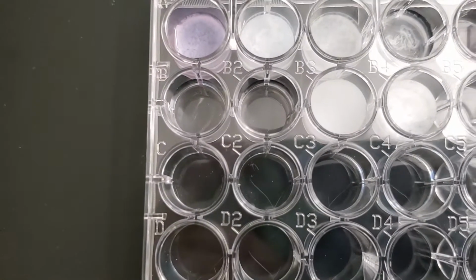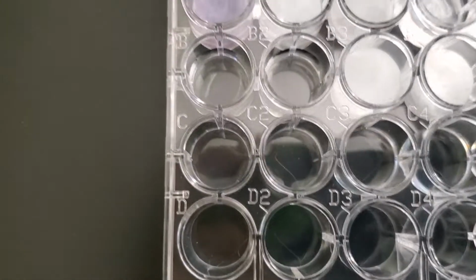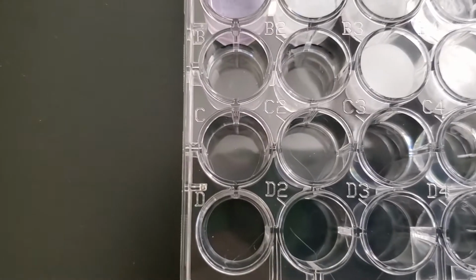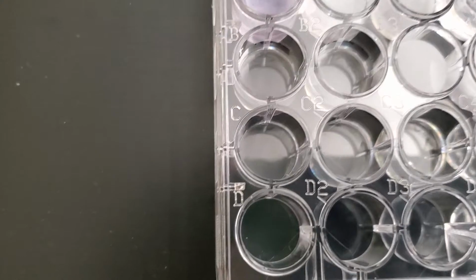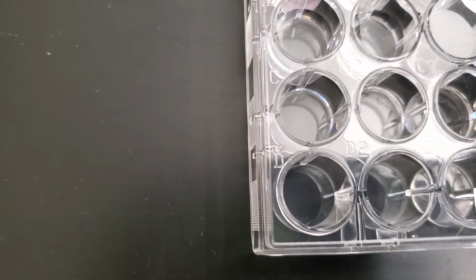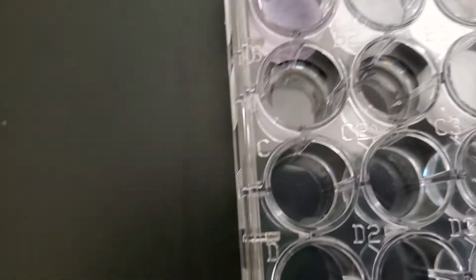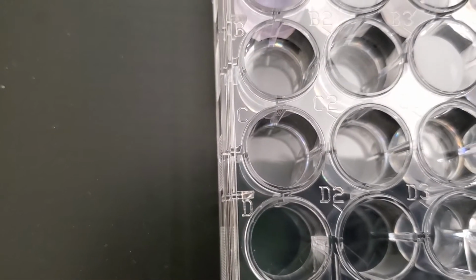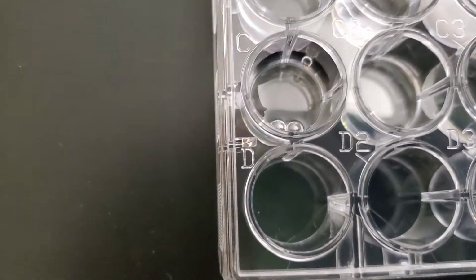Now I'm going to add a different chemical to the C row. So this is going to be potassium iodate. And so once again, adding it to the magnesium chloride, the calcium chloride, strontium chloride, and the barium chloride. Sorry, I need to grab a new pipette because that one's not grabbing my liquid. Okay, so C1. Okay, there's what happened with C1. Now C2.